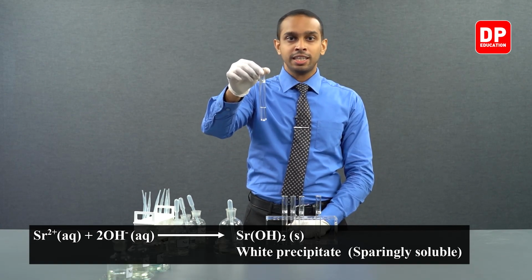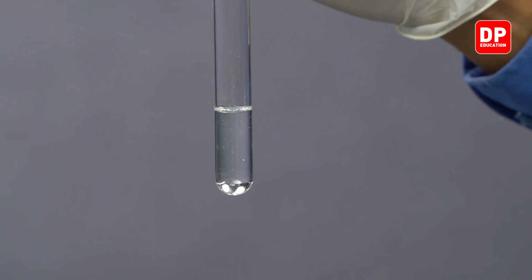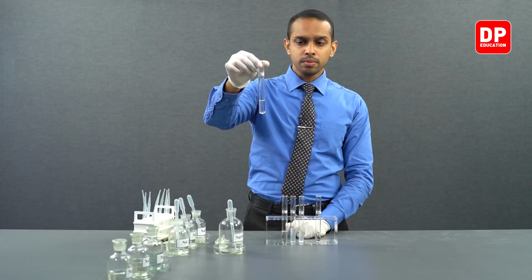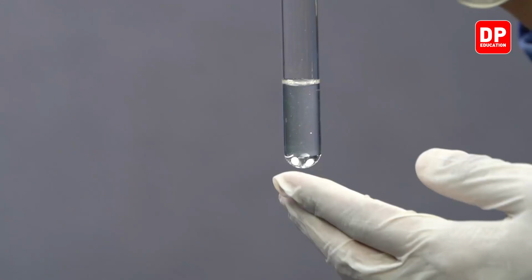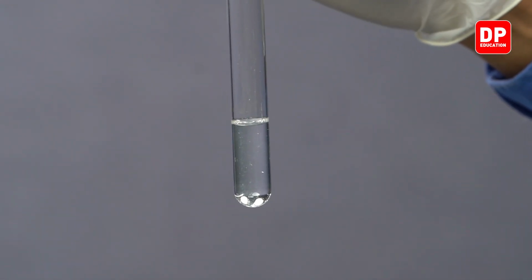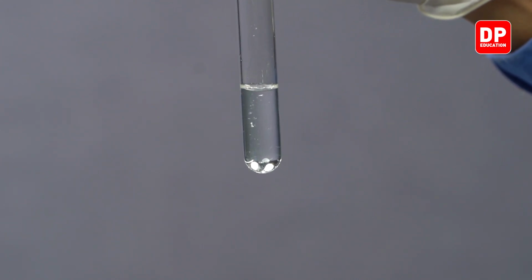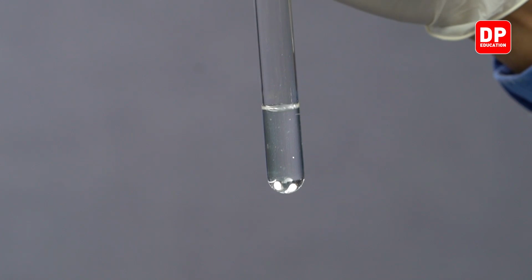In fact, it is sparingly soluble. So, if you leave this out for a while, you will see a white precipitate forming here. But this reaction will happen slowly. You will notice the formation of the precipitate very slowly.